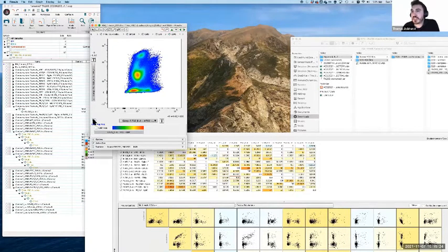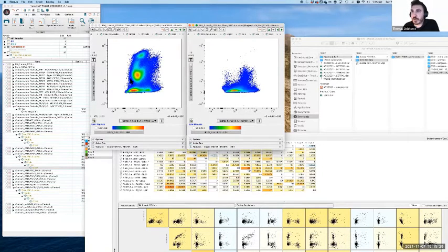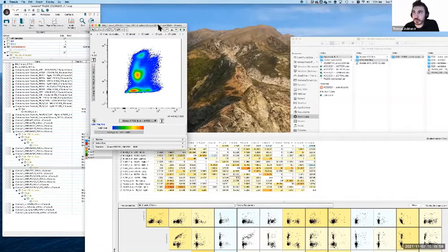If we look at particular things like CD4, this kind of pattern can be quite different. T cells have high CD45 naturally. They already express very high CD45. Whereas if we look at something like Ly6C, which in this case is expressed on various cells throughout the bone marrow, we actually do see that as it gets higher, we get more and more CD45. So how do we know, can we tell the difference between whether this is undercompensation that we need to correct, or if this is just biology where these two markers are correlated? That can be really tricky.